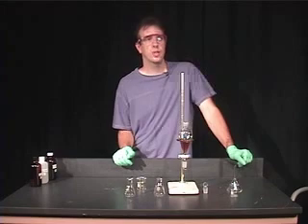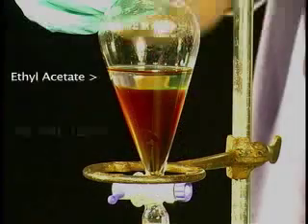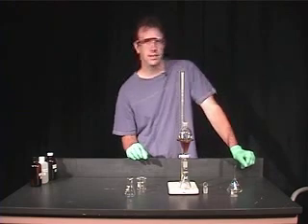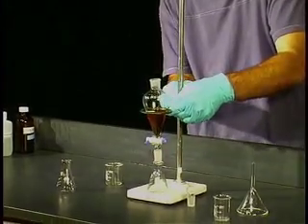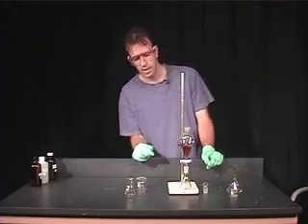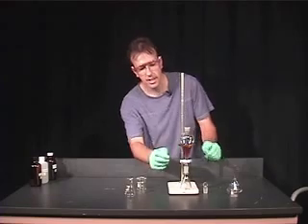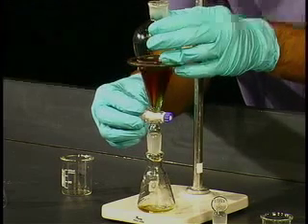When you shake it up, you'll let it sit until the two layers separate. I'll pick it up so you can see the two layers. Once they have separated well enough, I'm going to put our collecting flasks underneath. The aqueous layer is more dense than ethyl acetate, so it's the bottom layer. I'm going to lower this a little bit so we can get it over our collecting flask, and now you simply open the stopcock until you have the interface just at the level of the stopcock. You can open it fairly quickly at first and slow down as the interface gets closer.